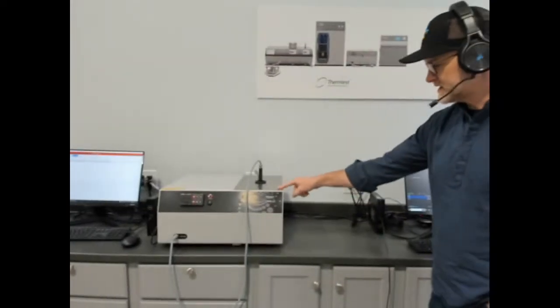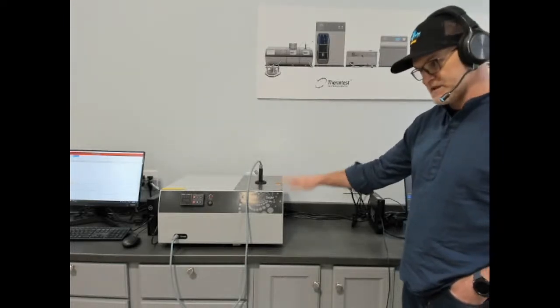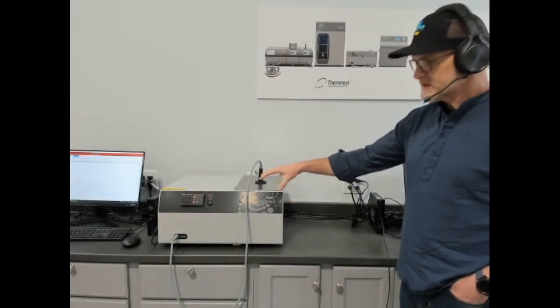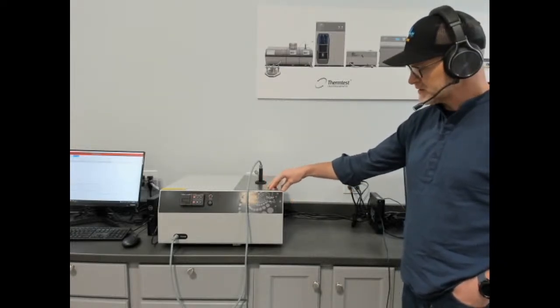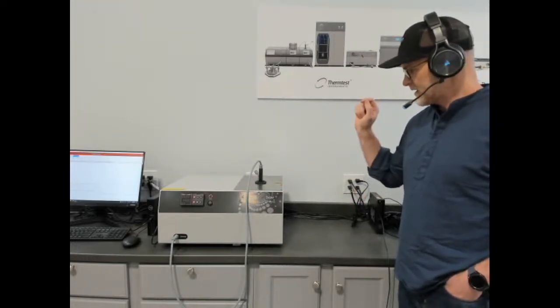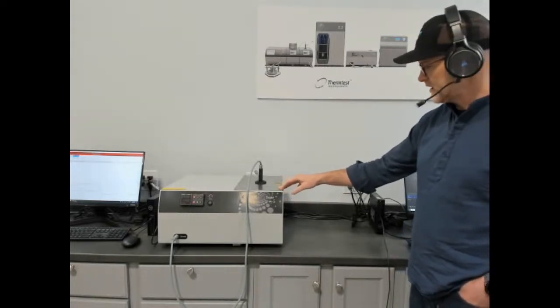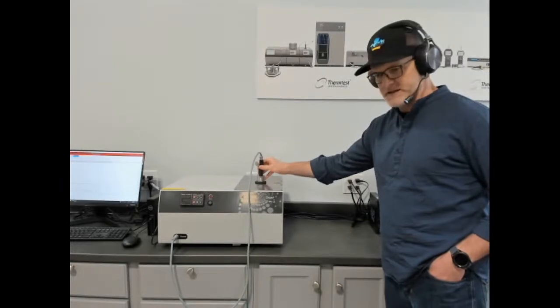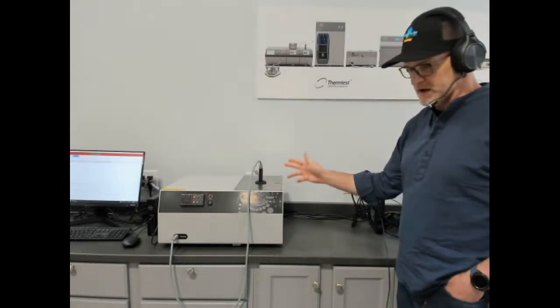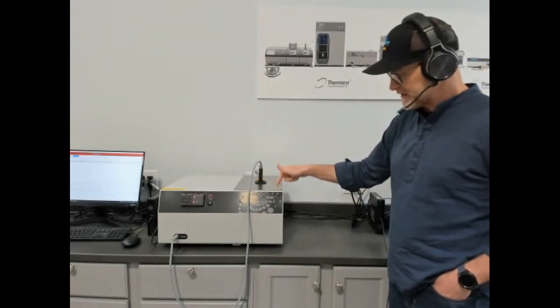Our focused THWL1, which is for thermal conductivity, diffusivity, and specific heat, and effusivity of liquids and phase change materials. This is our focus instrument specifically for those materials with no ability to expand into solids, just focused, following ASTM 7896. This is the transient hot wire method. It does allow you to test past boiling points because you can back pressure the sensor, 20 bar or 35 bar. This has an integrated temperature platform.